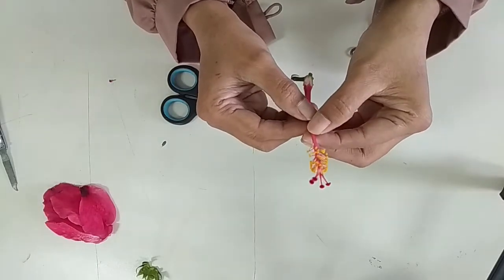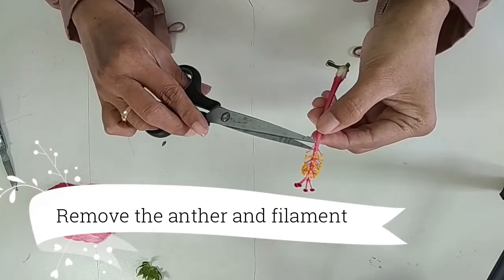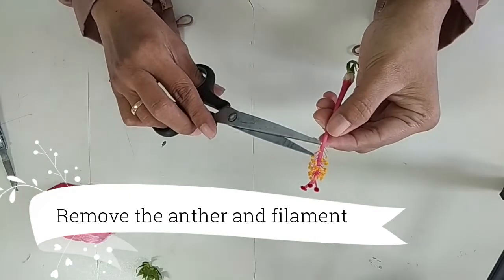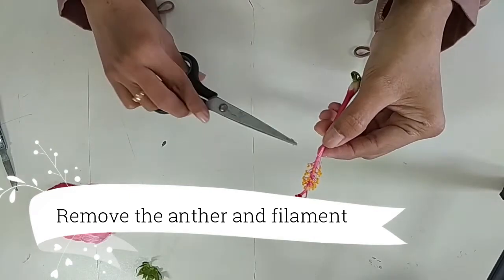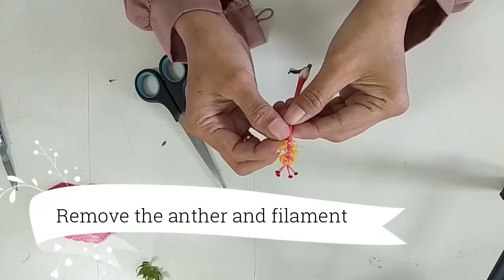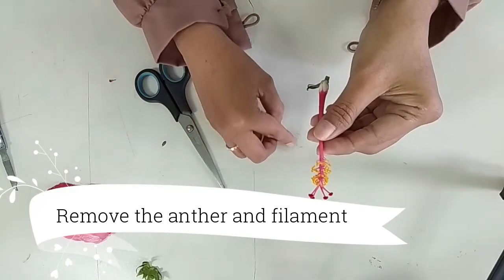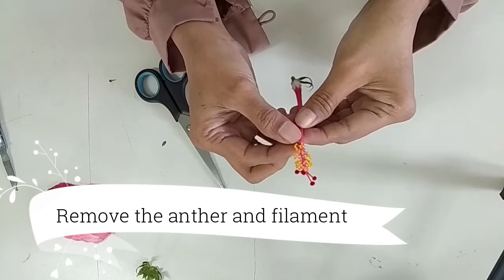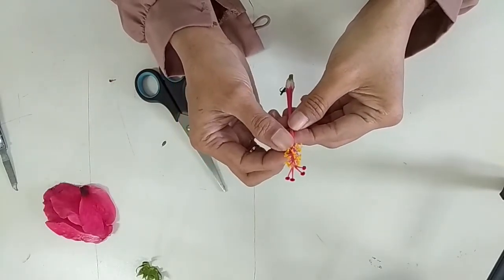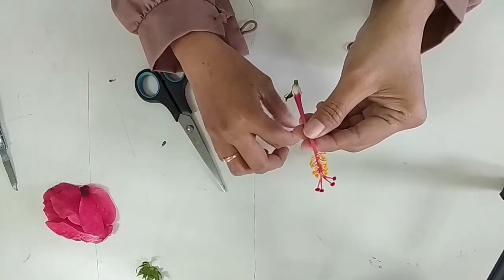And then remove the anthers and their stems. Anthers create pollen inside the stamen of the flower. The anthers are the yellow, furry-looking tips. Each one is attached to a thin stem. If you use your hand, be sure not to pull too hard, or you can rip off too much of the flower.